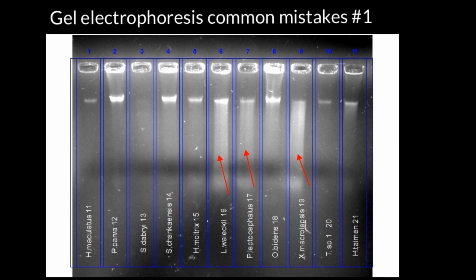First of all, I want you to pay attention to the wells, and as you see, still a lot of material is left here. So what might cause this? Probably this is caused by aggregation of the proteins with DNA. So our DNA sample is contaminated with proteins.